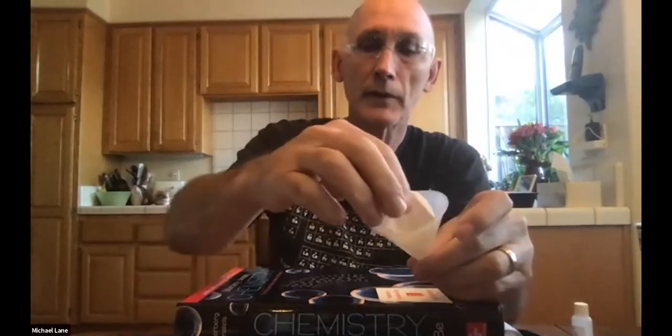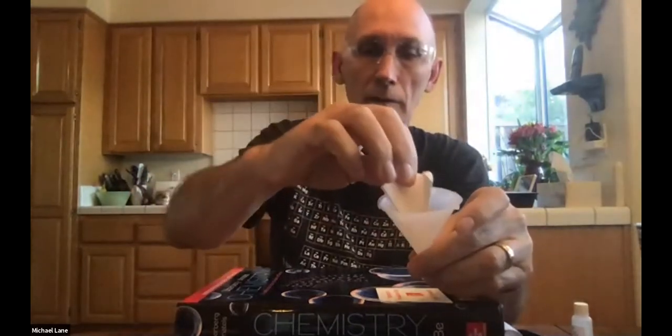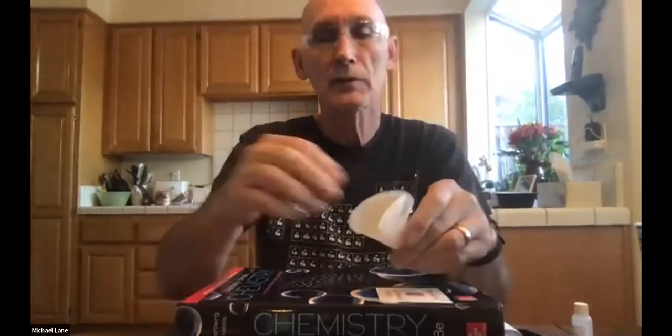And I realized I had my funnel just out of view, because we do need our funnel. Now, at this point, we've got the paper and the funnel, and we want to put that in there. Now, you can see that's not going to work very well, right? We can't start with that dry. Some of these will kind of bounce out on you a little bit, and everybody's is a little bit different. But we need to prep the filter paper here.